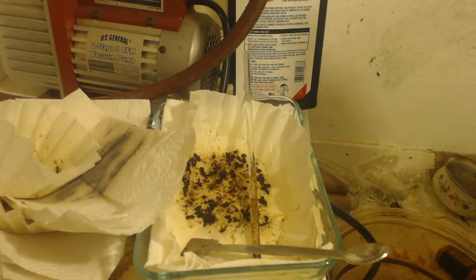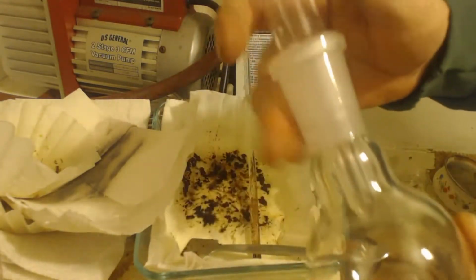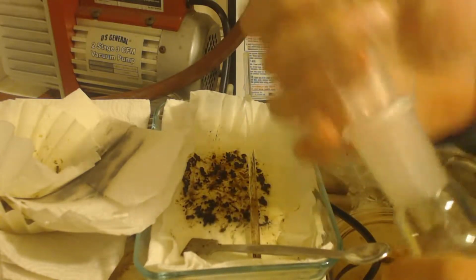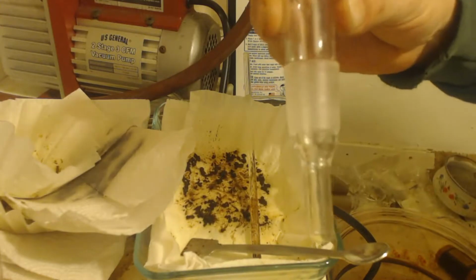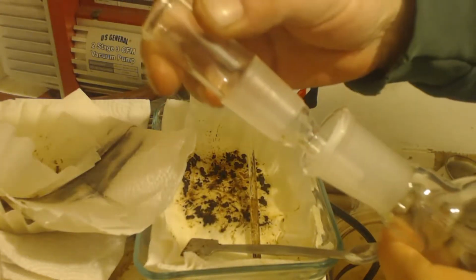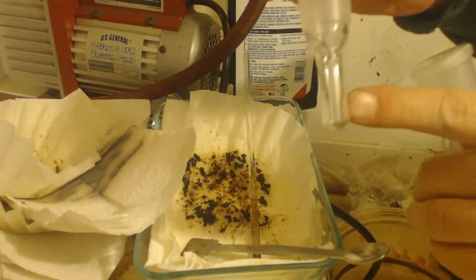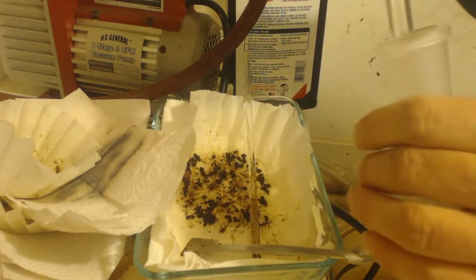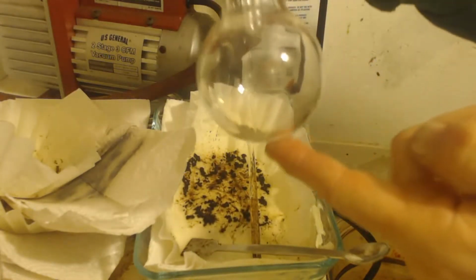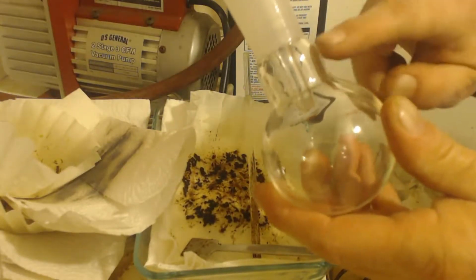But what I am going to do is put it in this round bottom flask. It's a 100 milliliter flask. And I'm going to put this top on. This is what you use for a thermometer. You can put a thermometer in there. And see how it has the ground glass joint. So I'm going to put water in here that's cold. You can see it's kind of like a cold finger. So the water will be in here cold. I'll heat up the bottom here, and it'll condense onto that finger.